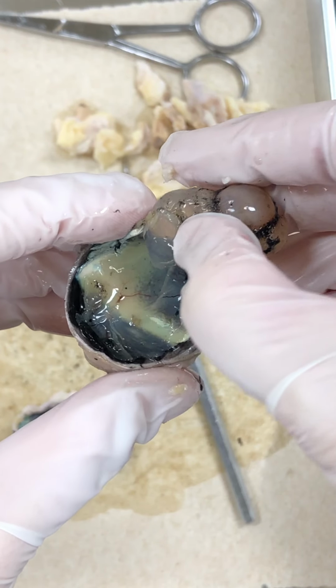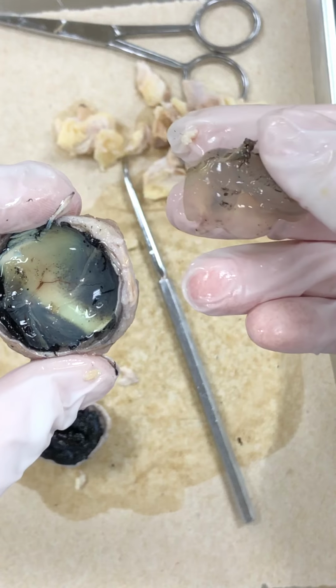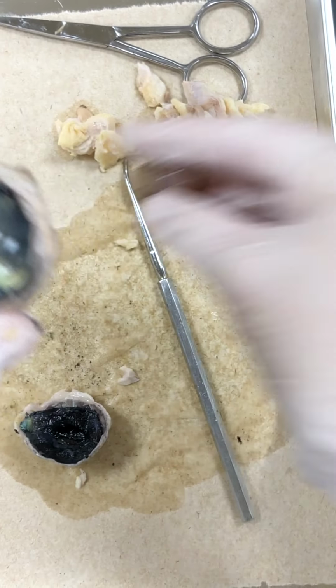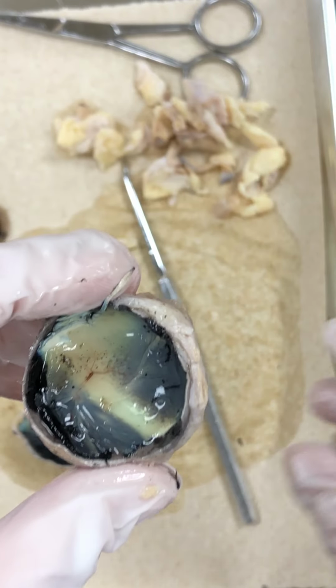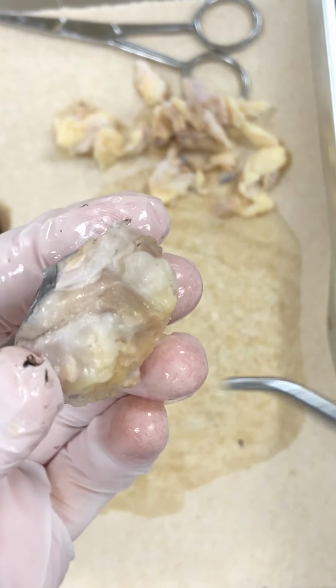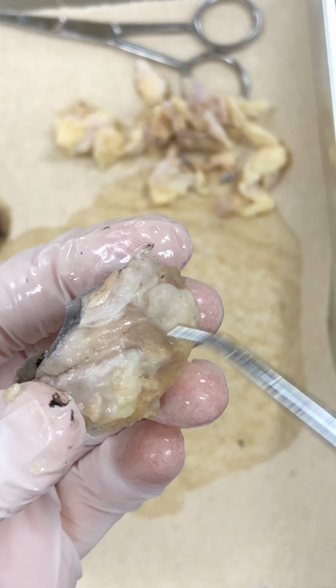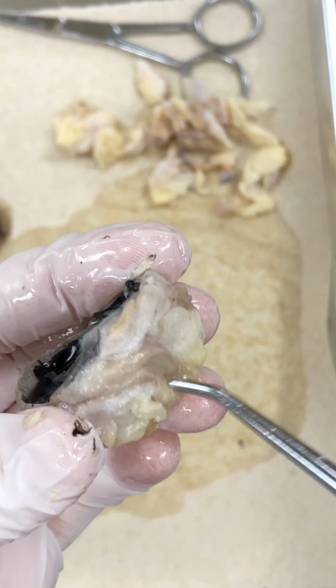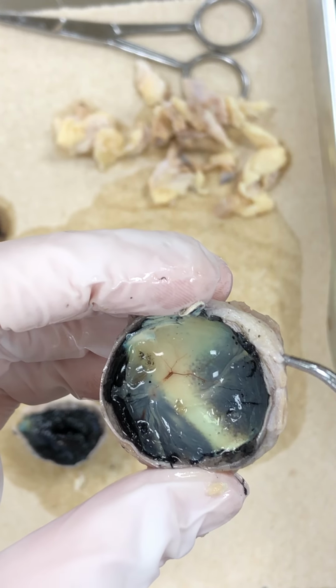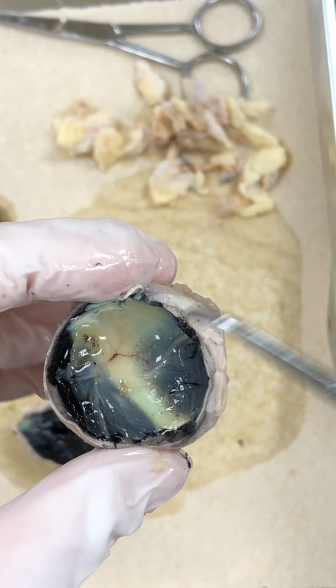the vitreous humor, again, there's the back of it, very jelly-like, helps to keep the shape of the eye. Okay, now we have the posterior eye. Now there's three structures to it. First of all, we have the sclera, all the white stuff, all the way around. If we could remove all the fat and all the muscles, we would see the sclera. You can kind of see it here, but it's the white part of the eye.